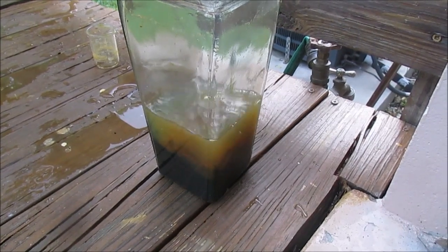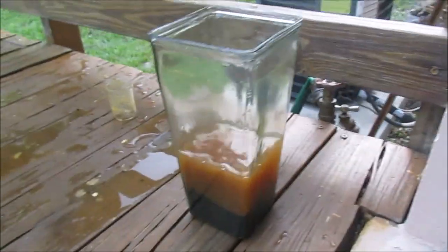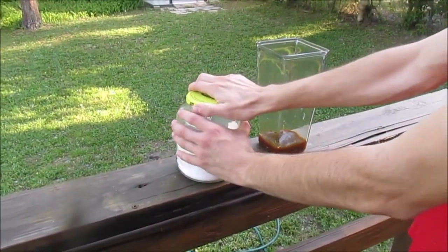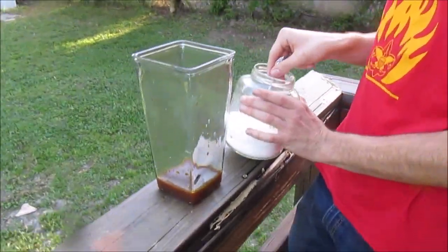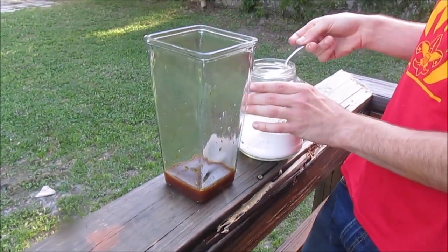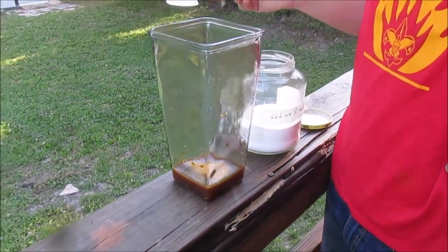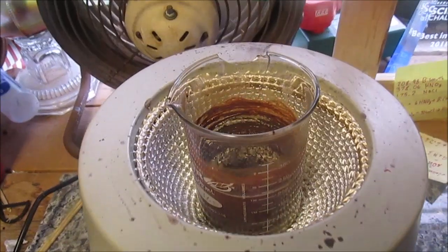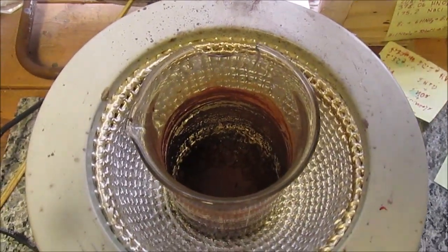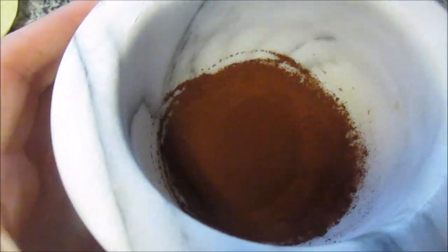With the iron chloride converted to iron(III) chloride in our bath by hydrogen peroxide, it was time to convert the chloride to an oxide. Finally, by adding sodium bicarbonate, we could release the iron as insoluble iron oxide, iron hydroxide, and a few other iron compounds, while creating soluble sodium salts which we then decanted off. Then, once we had the iron oxide and hydroxide mixture, we could heat them up, boil them off, and break down the iron hydroxides and carbonates into iron oxides. With our iron restored to its former oxidized glory, we were ready to make thermite once again.